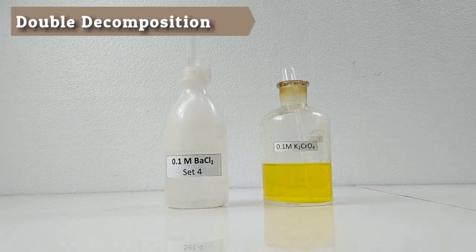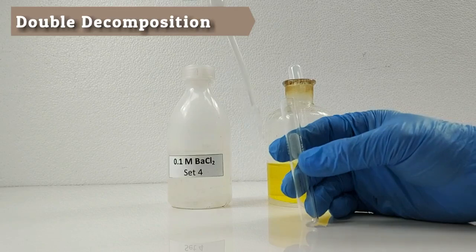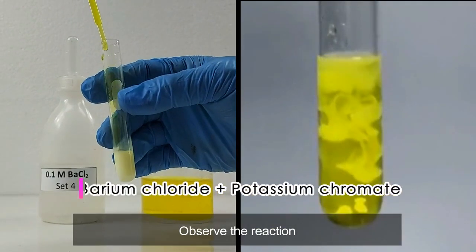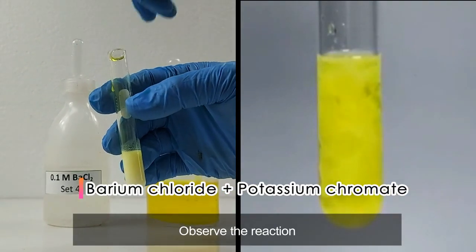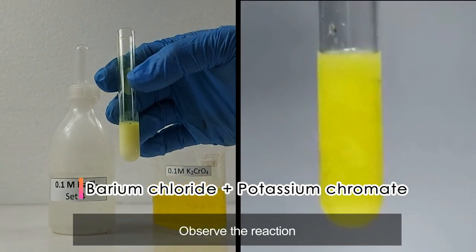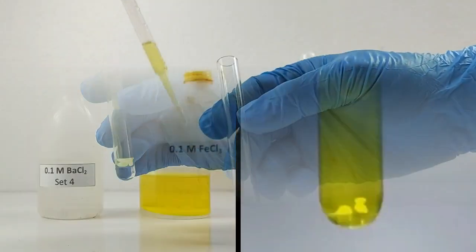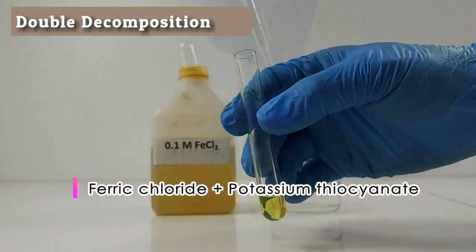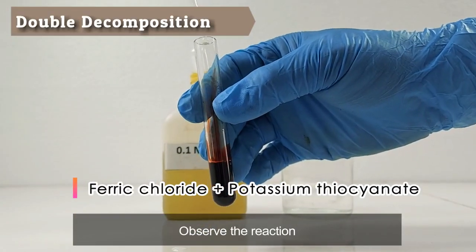Double decomposition. To 1 ml of barium chloride solution, add 1 ml of potassium chromate solution. Observe the reaction. To 1 ml of ferric chloride solution, add 1 ml of potassium thiocyanate solution. Observe the reaction.